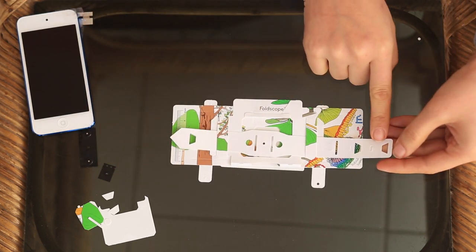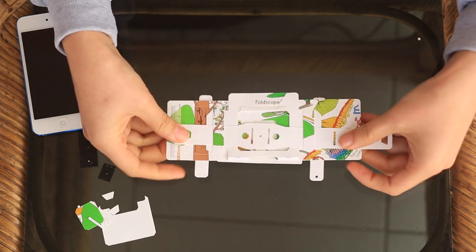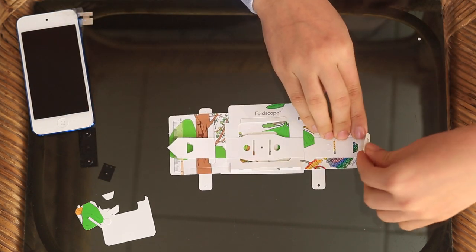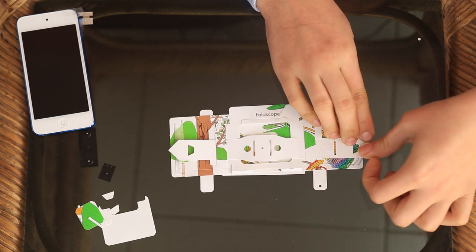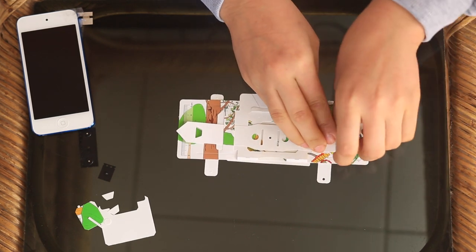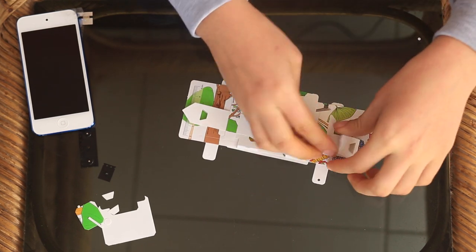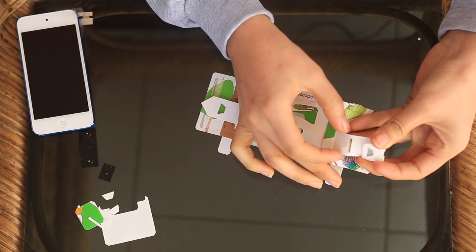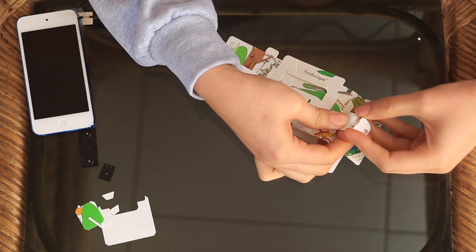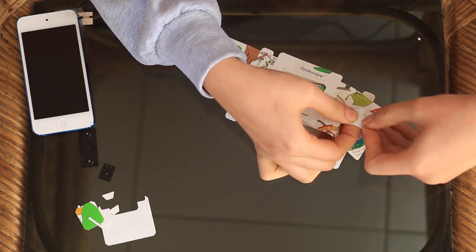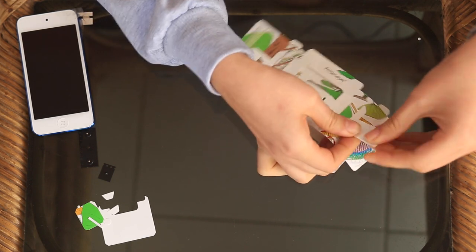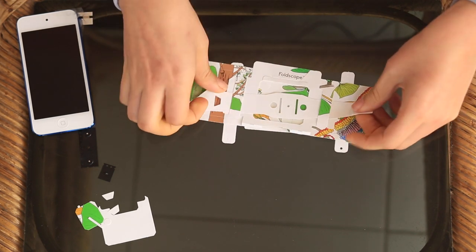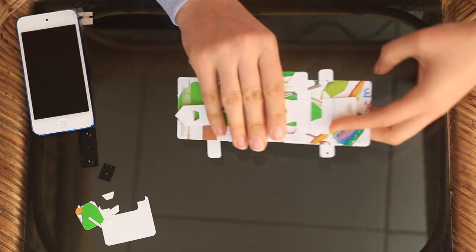Then you take his tail again and you want to make another handle so that you can pan around. What you do is you fold it once here and then once again. Then you take this tab that's right here and you put it into the end right here. The tab goes into this slot. Then that's steady and you have two handles to be able to do your panning with.